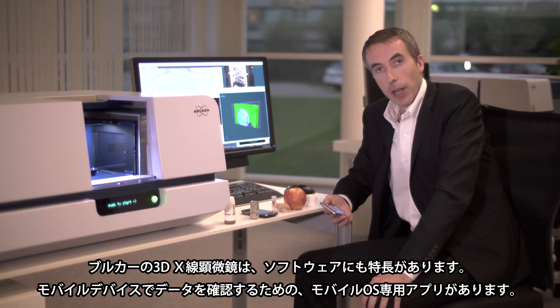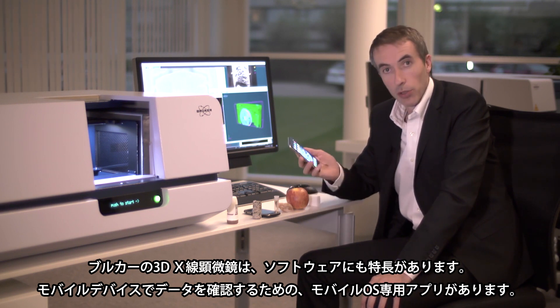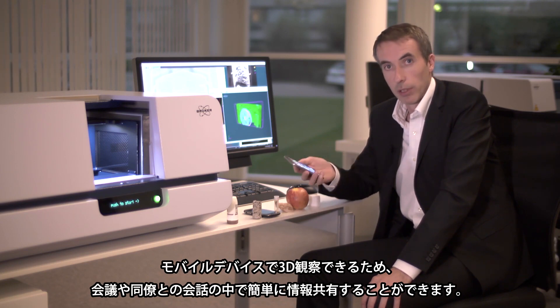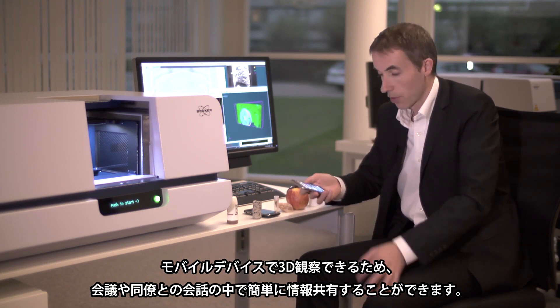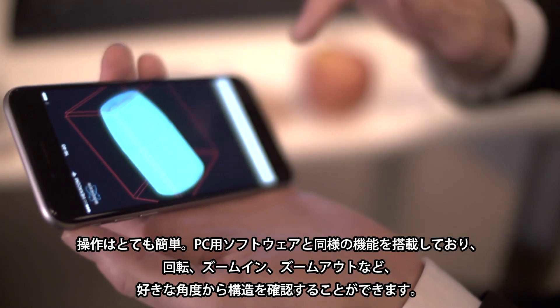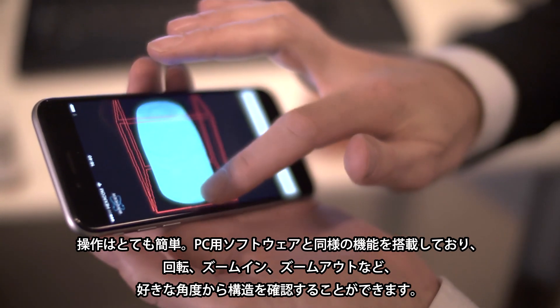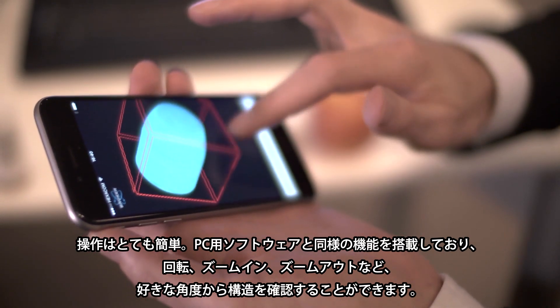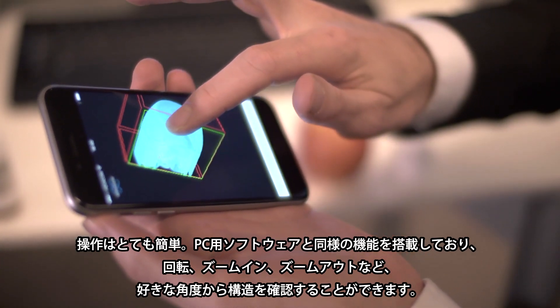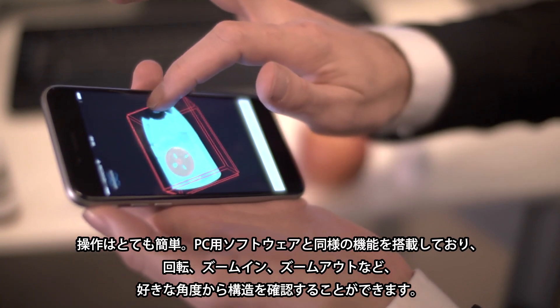Another nice feature developed at Bruker MicroCT is that you can load your data sets onto your mobile device. This allows you to share your data at conferences or during any kind of discussion with colleagues. You simply open the app, download the data set onto your mobile device, and using the same volume rendering software you can easily rotate, scroll through the objects, zoom in, zoom out, and cut the objects from any desired angle.